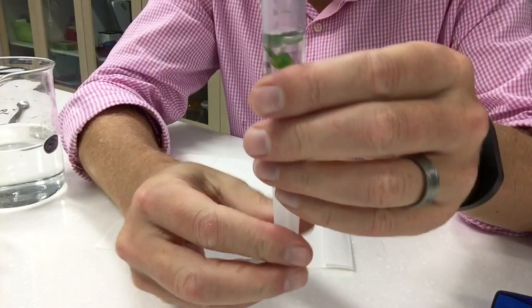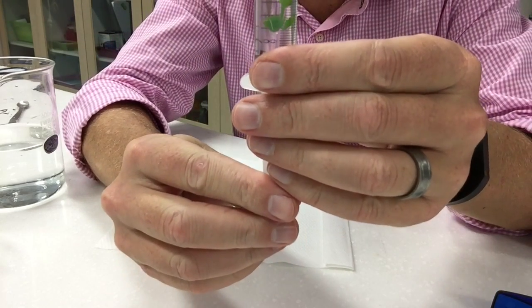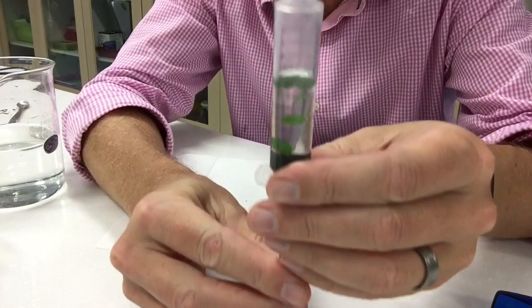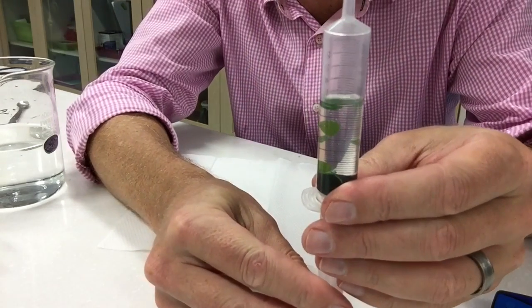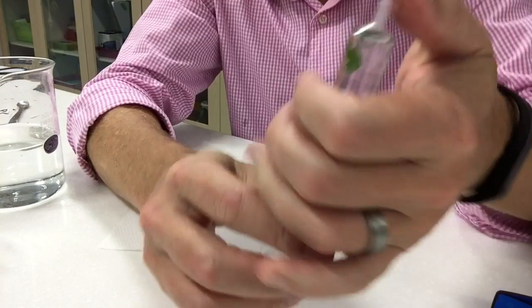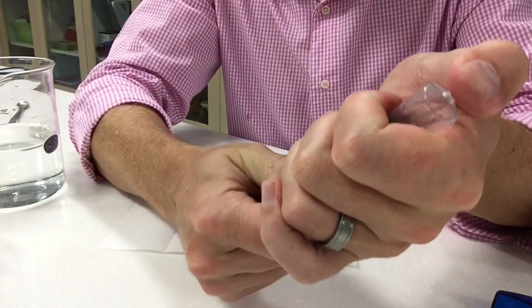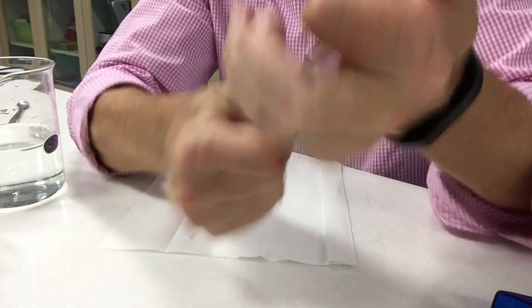You can kind of scrub ahead in there in the video if you want but yeah those are coming down coming down nicely. Just kind of give it maybe one more. You don't want to over evacuate because then the experiment's going to take too long so it's a real fine line.